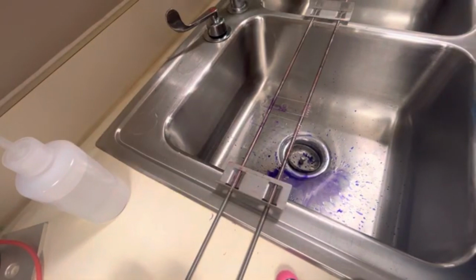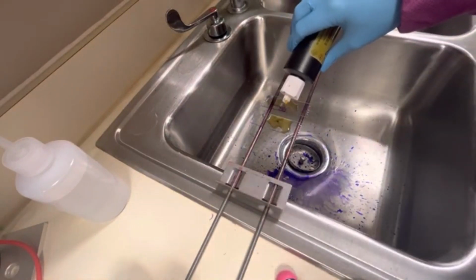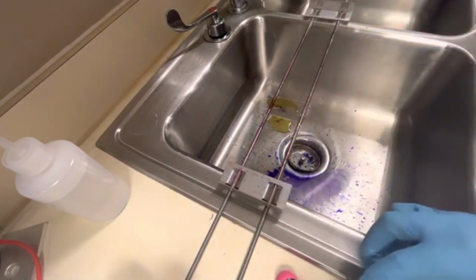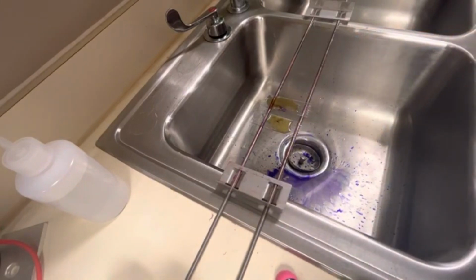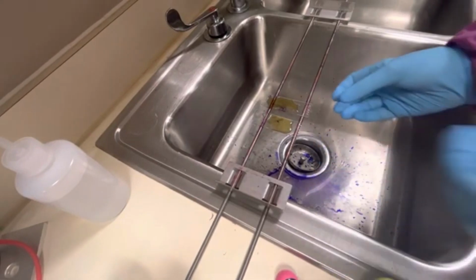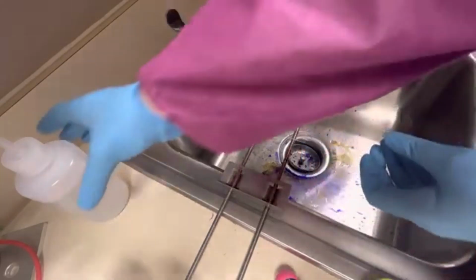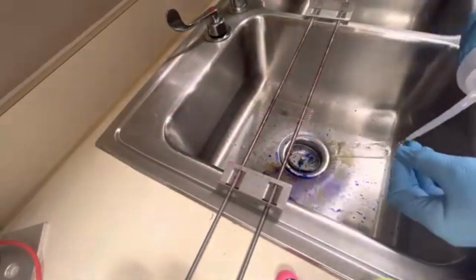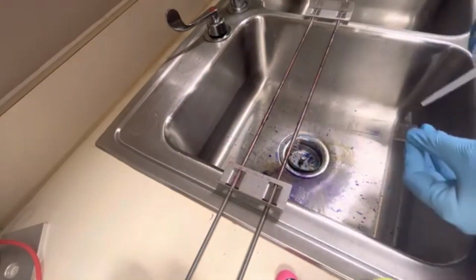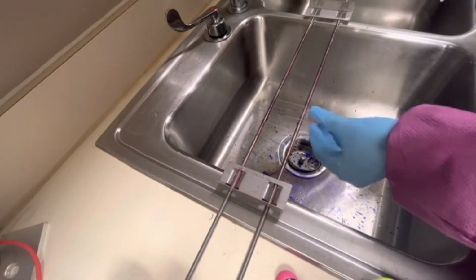All right. Then the next step is I'm going to put some gram's iodine on it, and I'm going to set my timer for 1 minute. When that timer goes off, I'll come back to you. Okay, that 1 minute timer has gone off. So I'm going to dump this iodine off of these slides, and then rinse them with water again. Okay, what's the next step here? Do you remember? It's decolorizer.